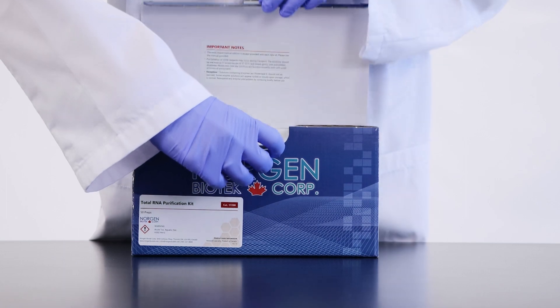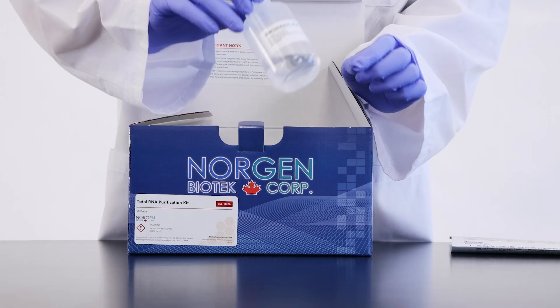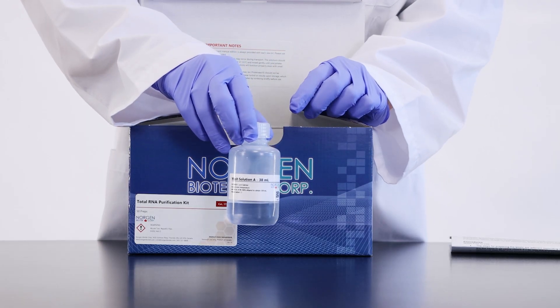Upon opening the kit, you will find a detailed product insert, wash solution A, and buffer RL.